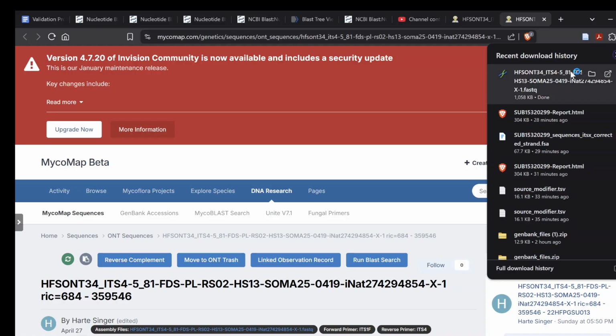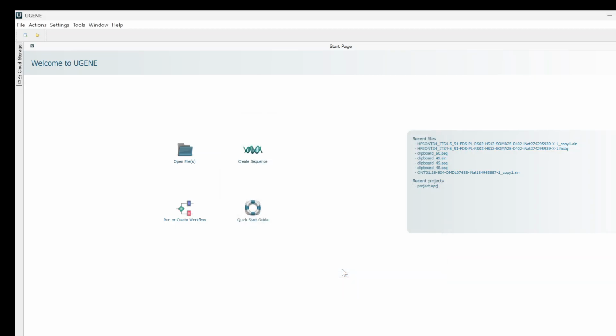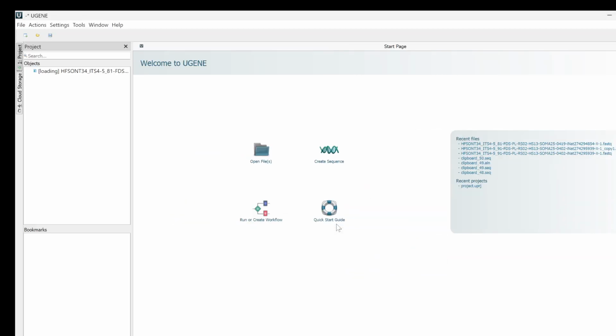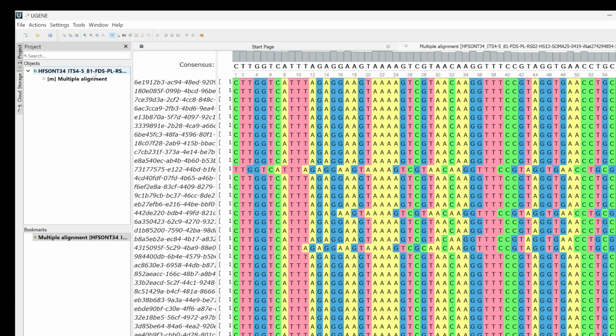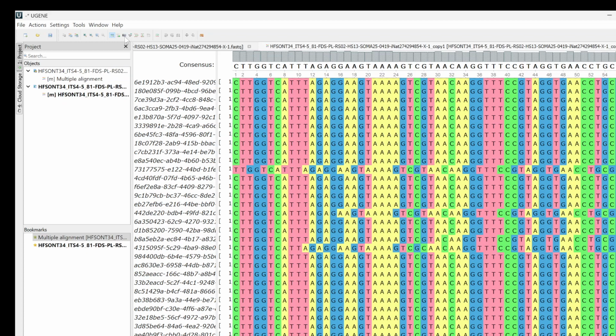Okay, let's look at some haplotype phasing. So I'm gonna do a typical UGENE maneuver here. Start out just the same way. I'm gonna save the alignment as ClustalW format. I'm going to align this with MAFFT.